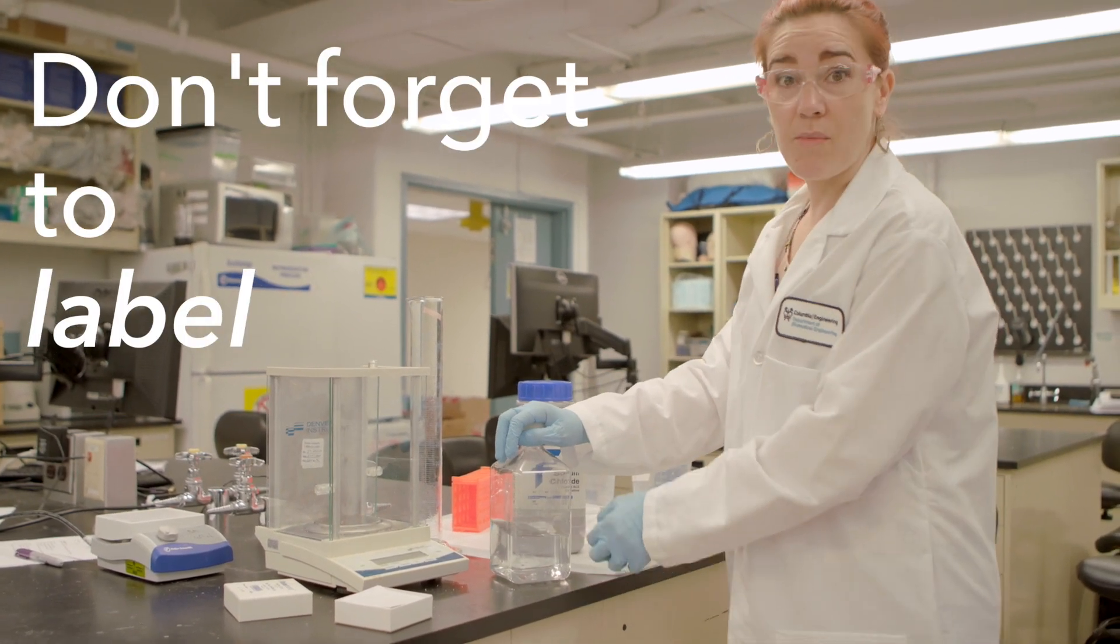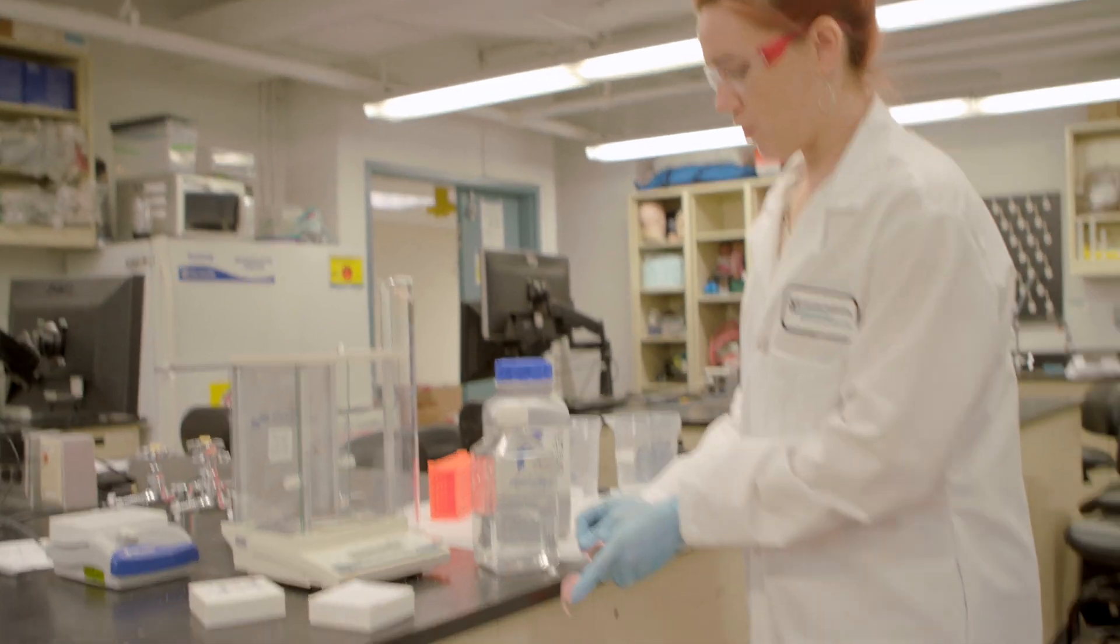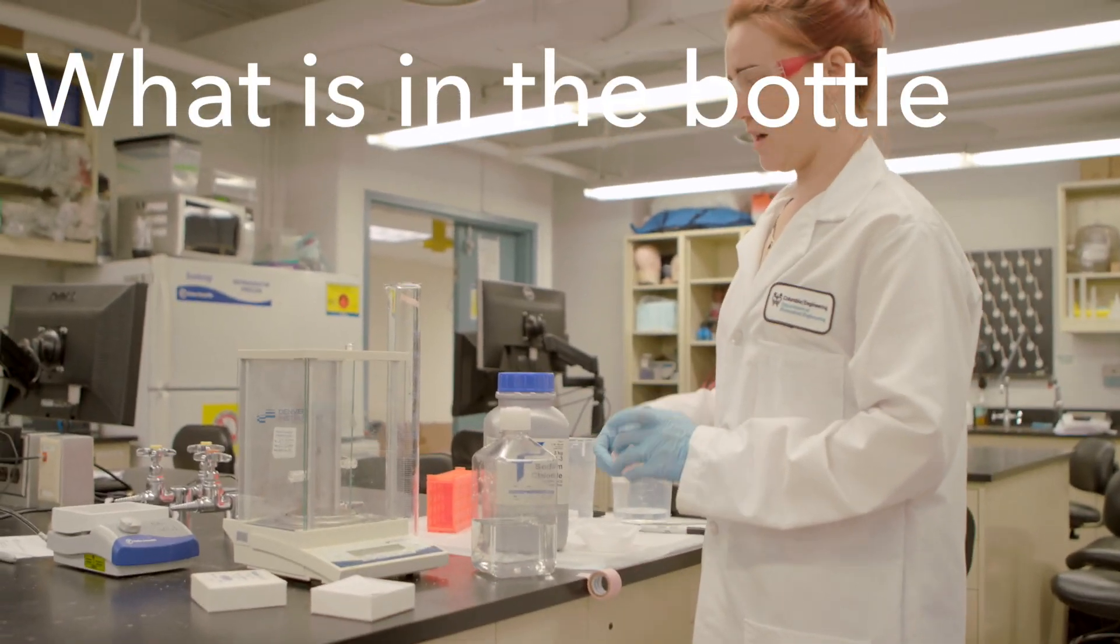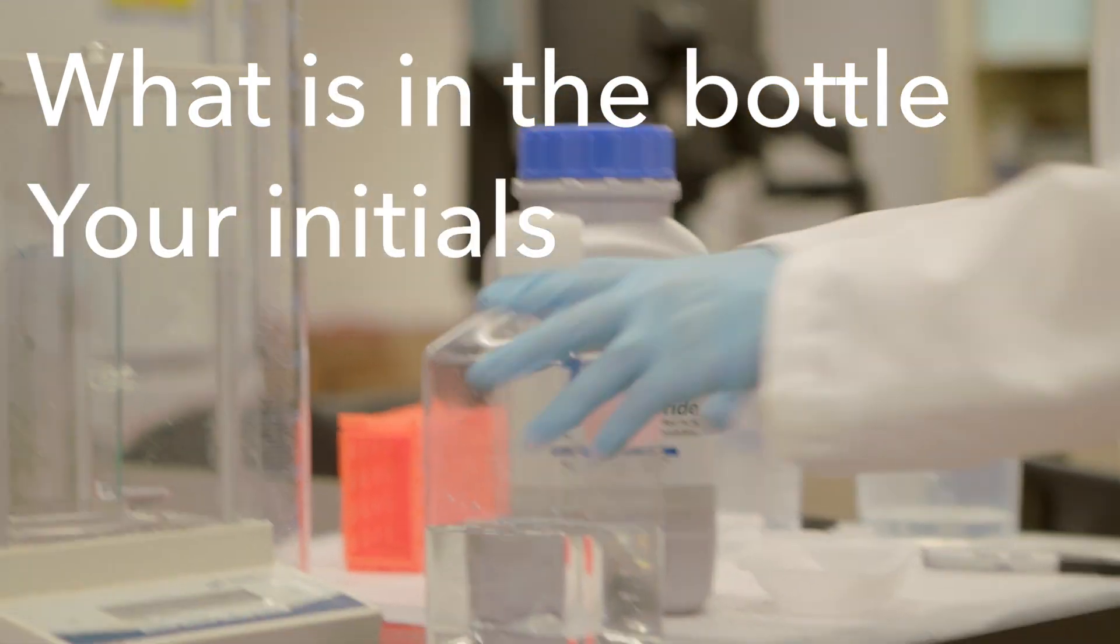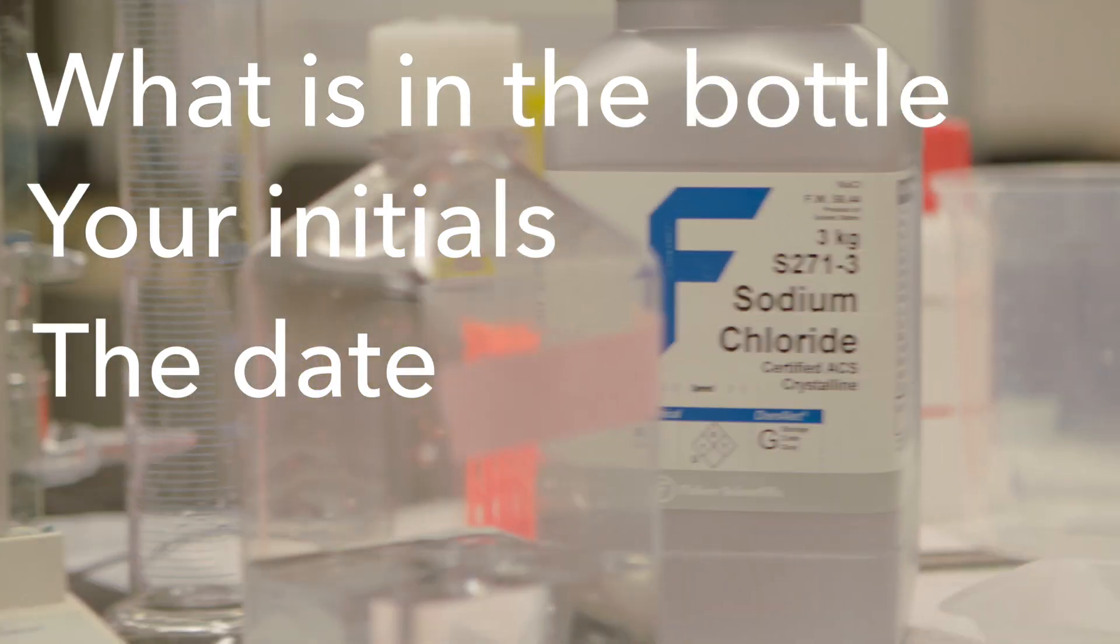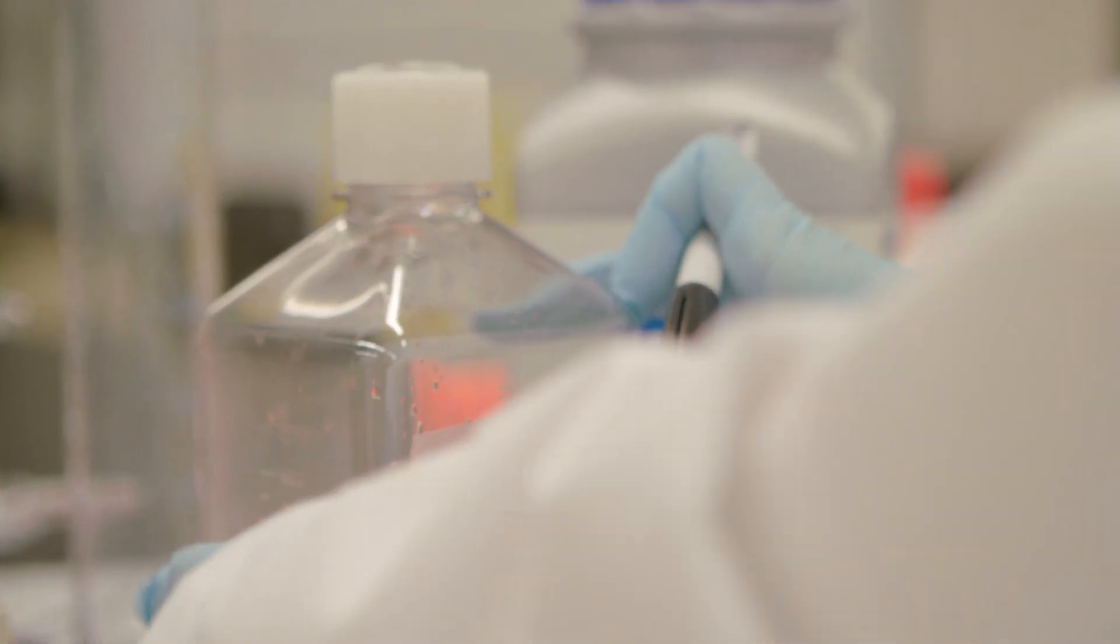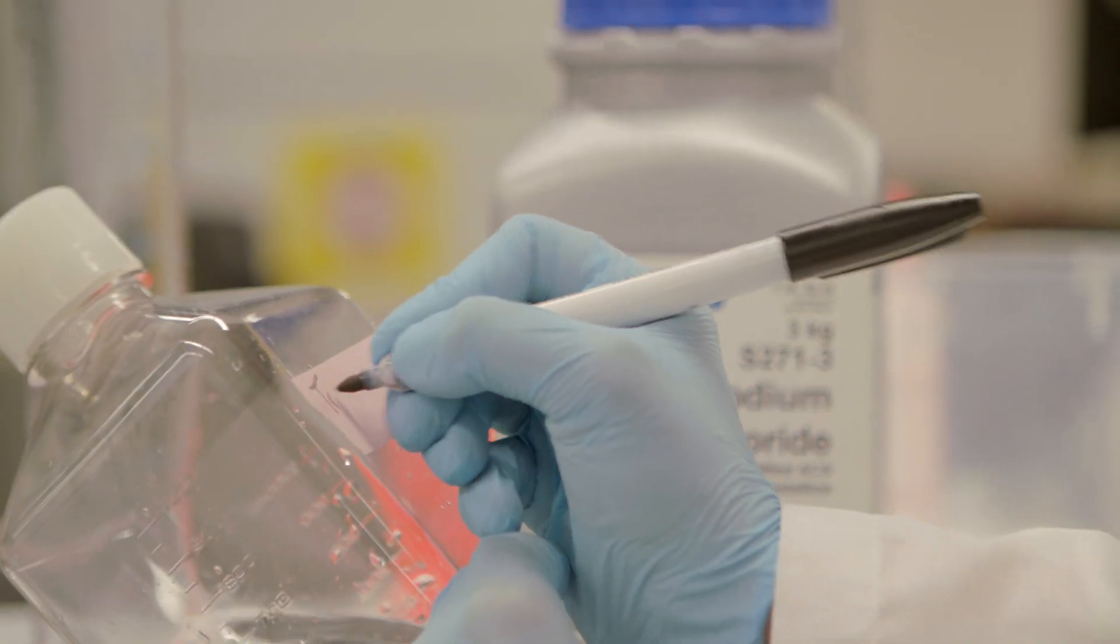Most importantly, we don't want any unlabeled liquids in our lab. So you always want to put what's in the bottle, its concentration if relevant, your initials so if there's any questions about who made it or how it was made, people know who to ask, and the date it was made so it can be determined if it's expired if it's sitting on a bench.